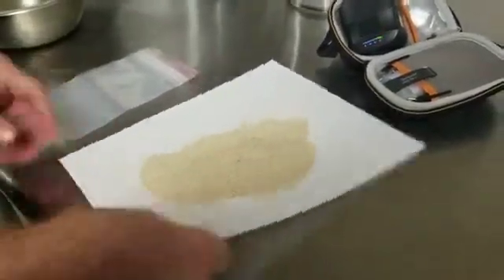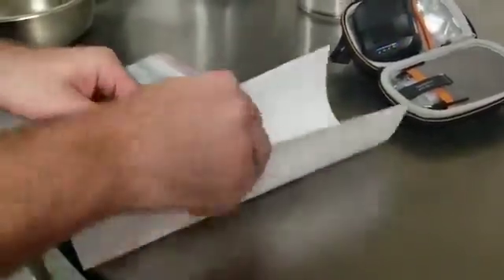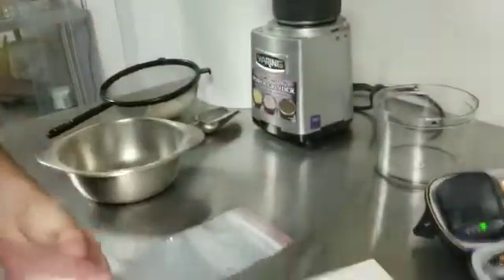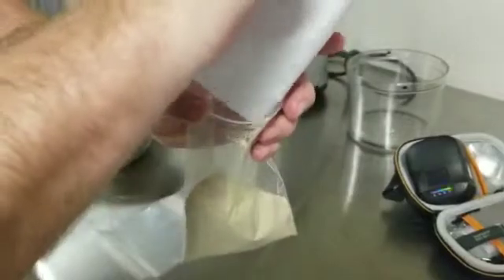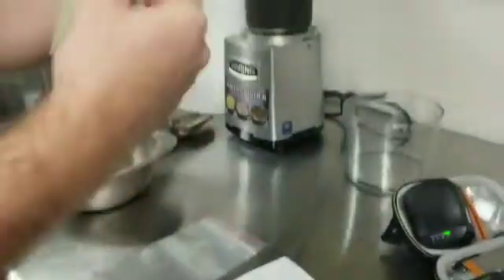We're going to put this in our bag. We use a standardized type of bag. Doesn't really matter what kind, as long as you calibrate the system to that bag.